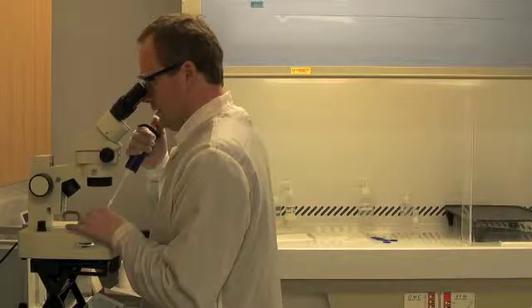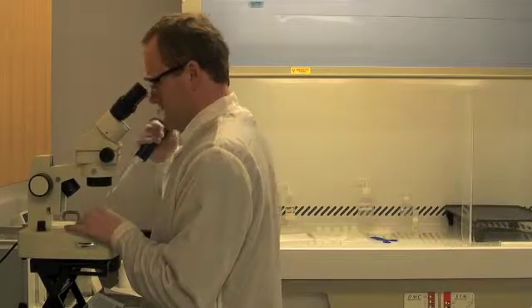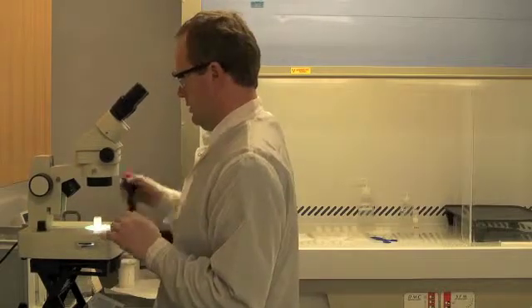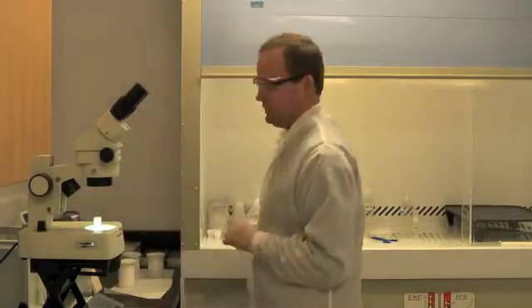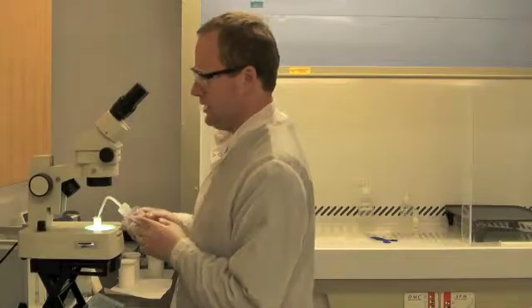And now I'm going to pipette as much of that water away as I can. I'm going to rinse the crystal with a small amount of dilute nitric acid.